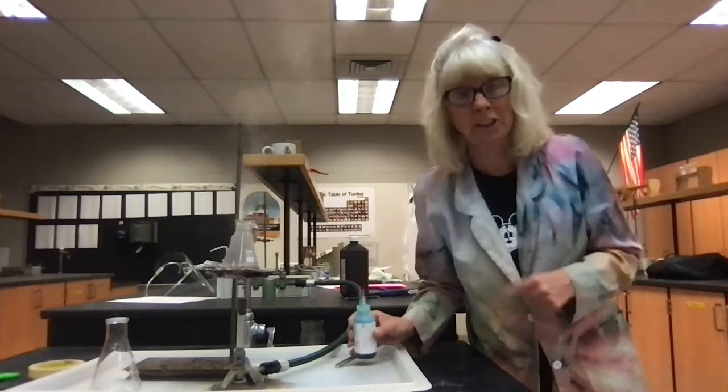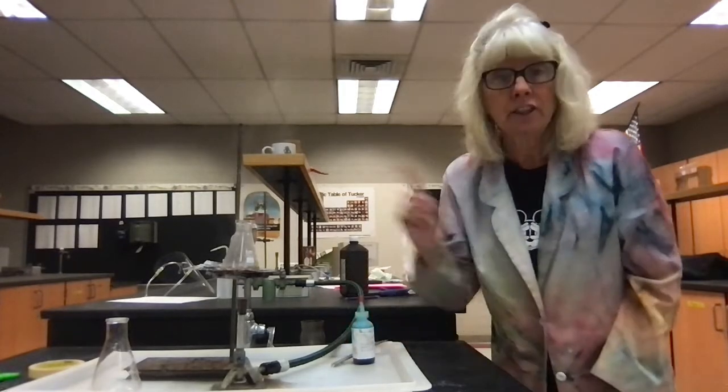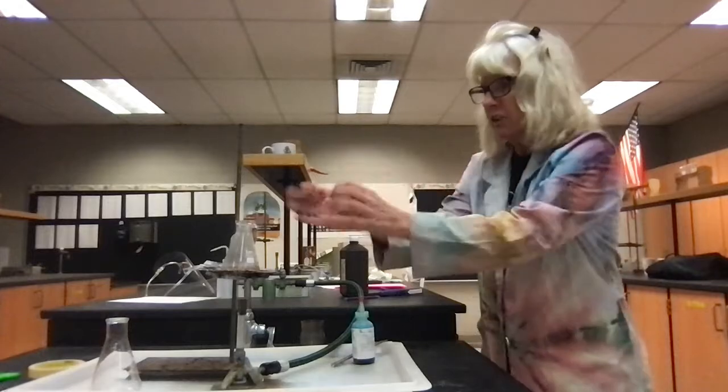That reaction has now gone to completion. Did you notice that green stuff that was in there? What do you think that was? That was actually the new activated complex that is formed by the use of the catalyst. It's a totally different pathway to get from reactants to products.